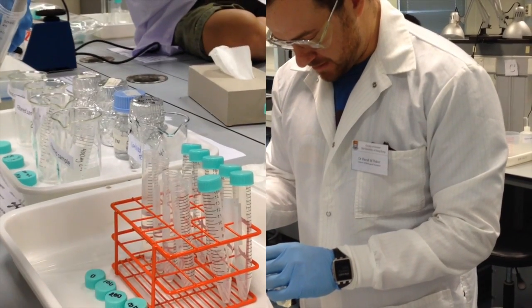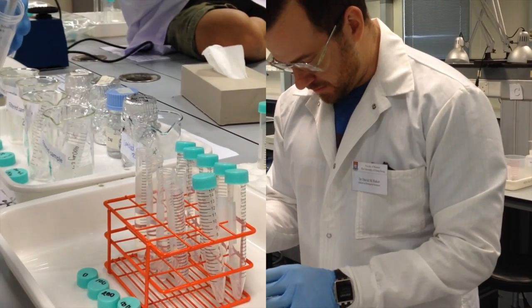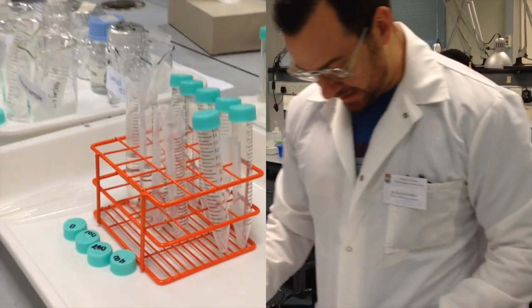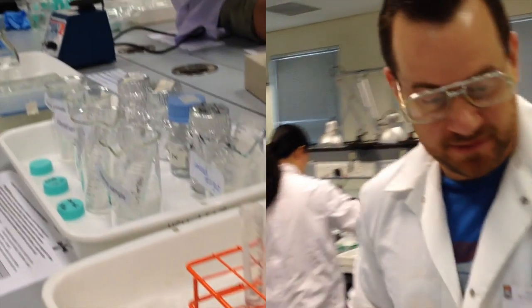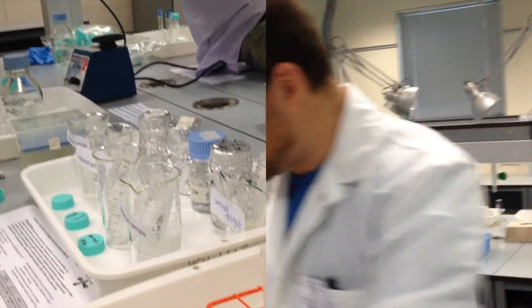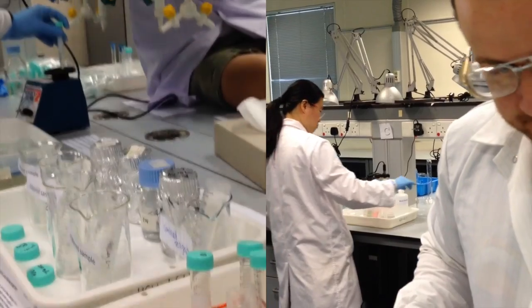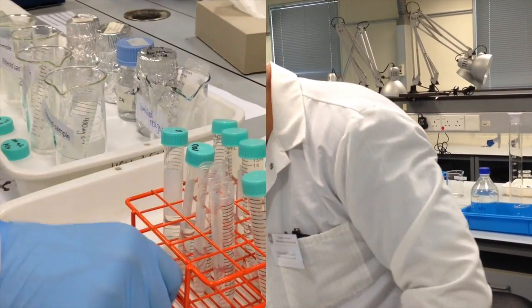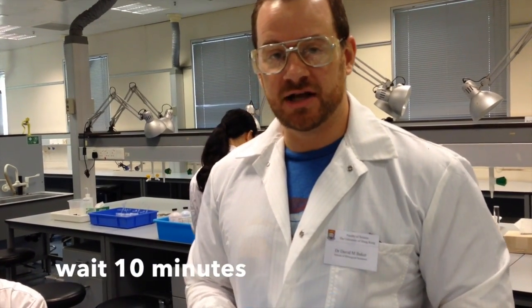1, 2. Now I need to cap each of my sample tubes, and I will vortex it briefly, just like we did with ammonium. So now I'm simply going to wait 10 minutes for a color change to develop, and then I'll return. I'll transfer my samples into cuvettes, and we'll use the spectrophotometer to measure the absorbance.